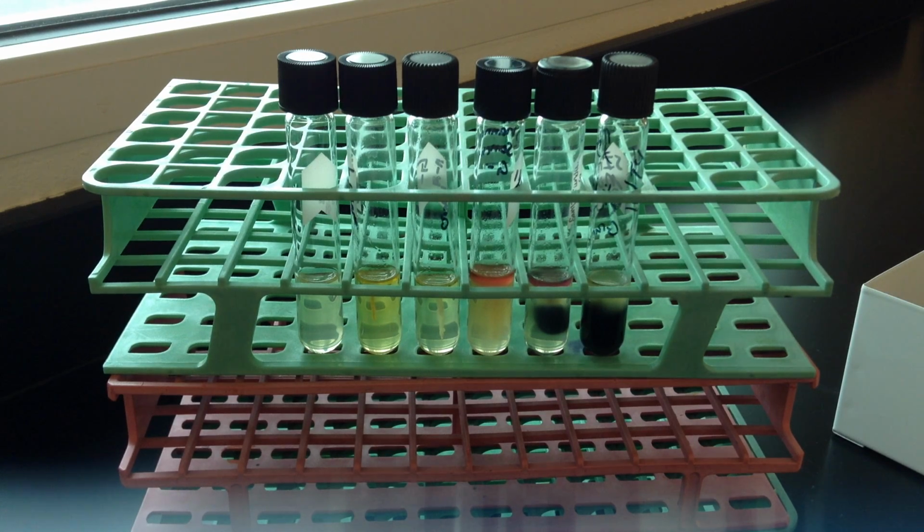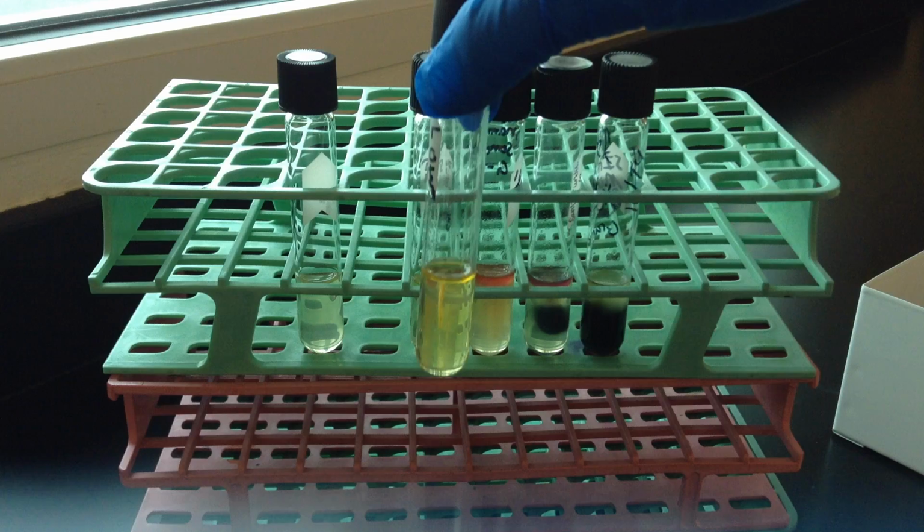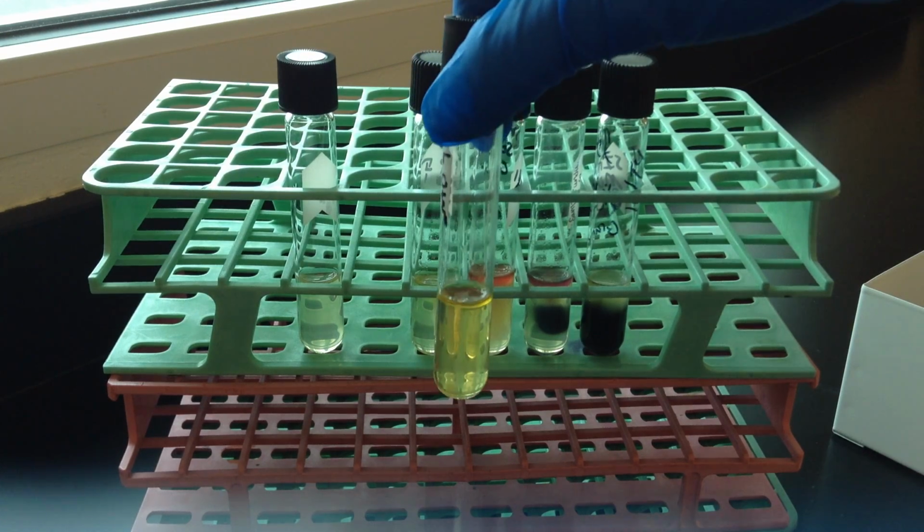And then the last piece that we look at in SIM, the M part, is motility. And motility occurs if the organism has a flagellum. And we can do this again, we've got to have a pretty good stab into the deep. So the one I'm holding up here is not motile.